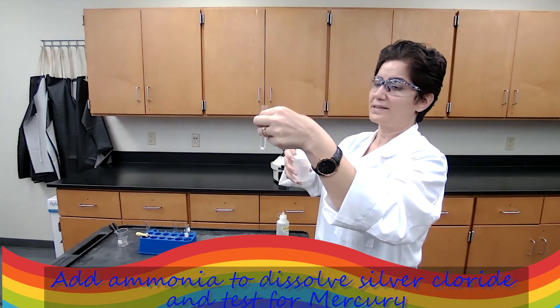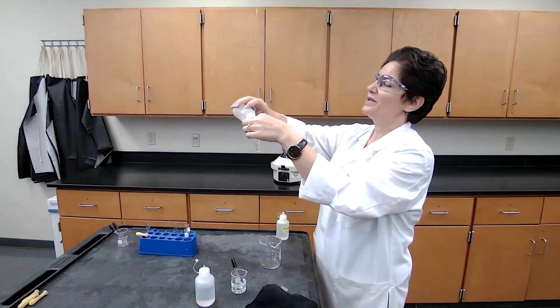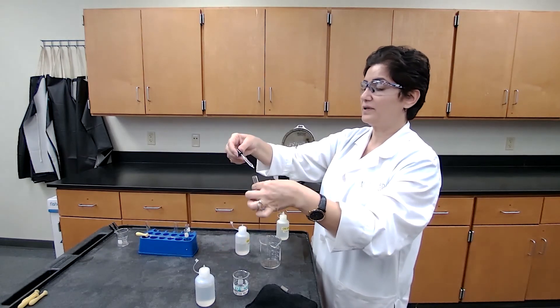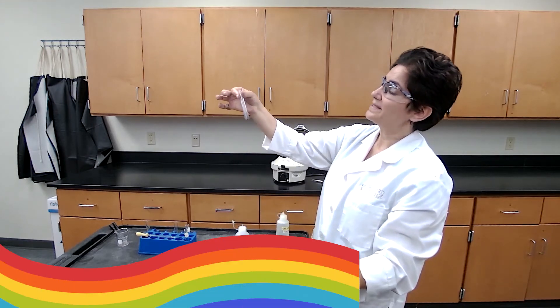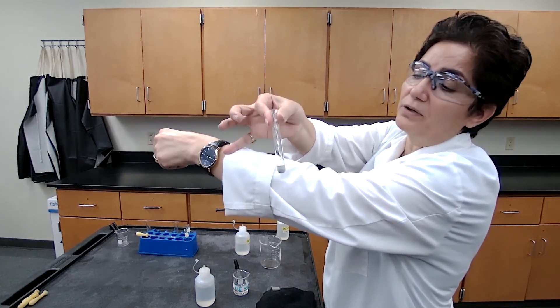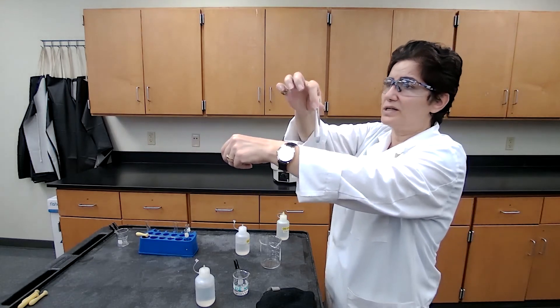To analyze for mercury and silver, to the precipitate from the last step we are going to add 6 molar ammonia, which is basically 6 molar ammonium hydroxide — ammonia by itself is a gas, so ammonium hydroxide is its solution form. We add 8 drops of ammonia and 4 drops of deionized water. If a gray to black color precipitate appears, it indicates the presence of mercury — I'm holding it against a white background so you can see the dark color confirming mercury is present.